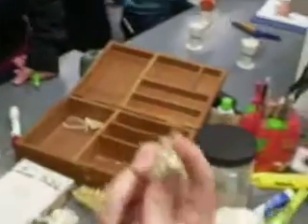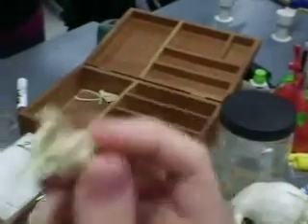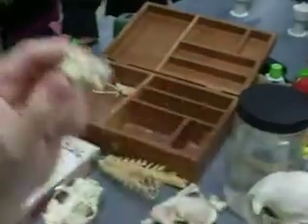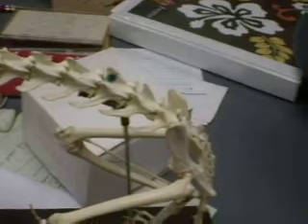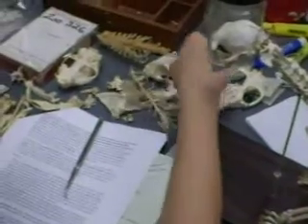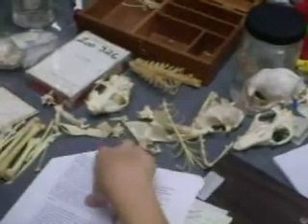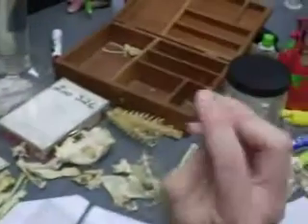You have the sacral vertebrae, very distinctive, fused, and this articulates with the pelvic girdle, which is what forms the hind limbs of the cat. And then you have caudal vertebrae, just small, regular bones. Like this. These make up the tail. Okay?